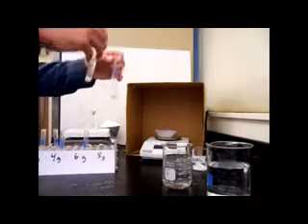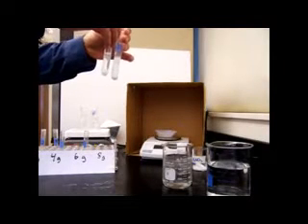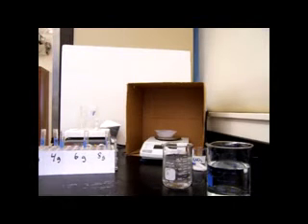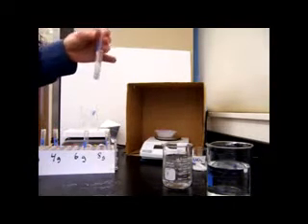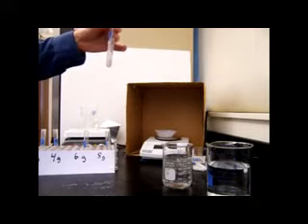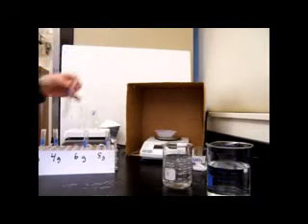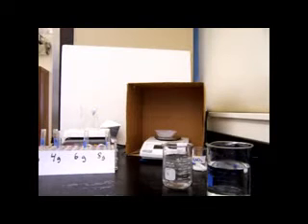If you look at the solutions right now, we can mix them around a little bit, and they don't dissolve all entirely right away. In order to make things dissolve faster, there's a couple things we can do. One thing we can do is stir it. That brings the solute particles in contact with the solvent more frequently and makes them dissolve faster. We can also change the surface area by making the particles smaller, or we can use heat. So when we heat things, generally at higher temperatures, they'll dissolve more quickly.